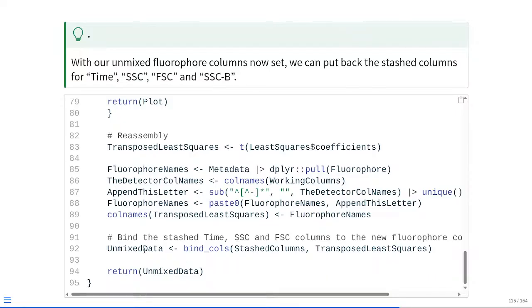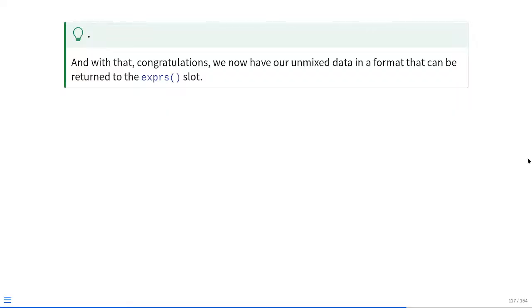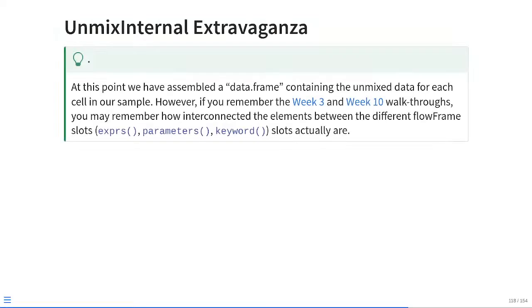And this will be our unmixed data object, which is what we'll end up returning to our local environment. At this point, as you can see, time, side scatter, forward scatter, side scatter blues, and then the actual fluorophore columns appear in sequence. And with that, congratulations, we have now unmixed our data into a format that can then be returned to the exprs slot. So at this point, we have assembled a data frame that contains the unmixed data for each cell in our sample.